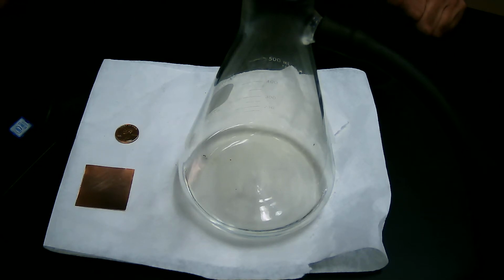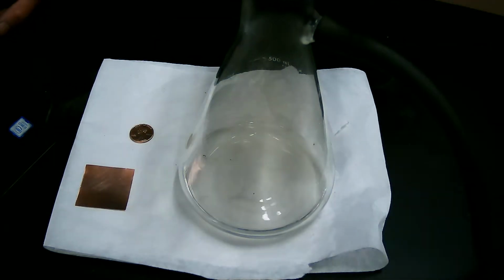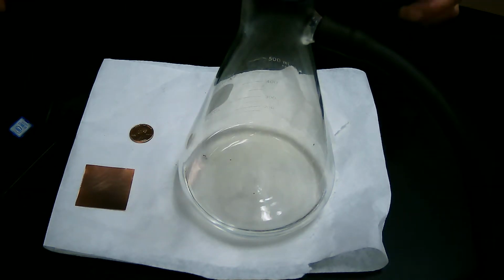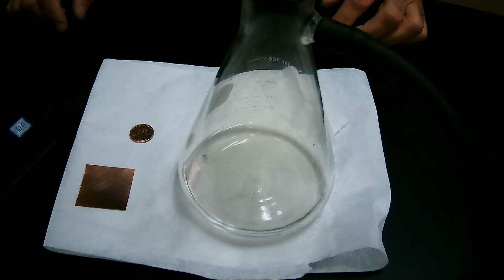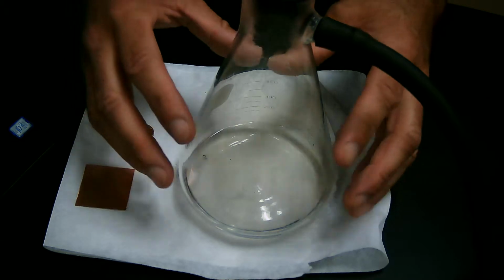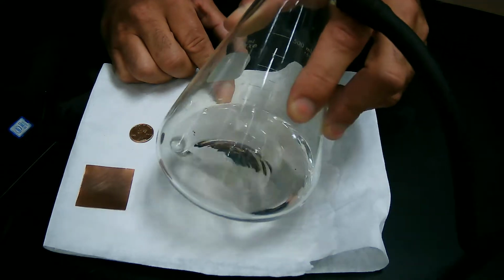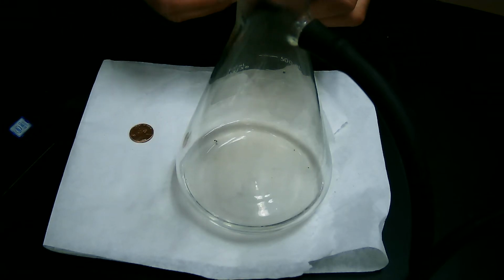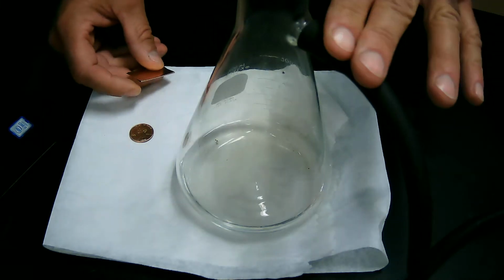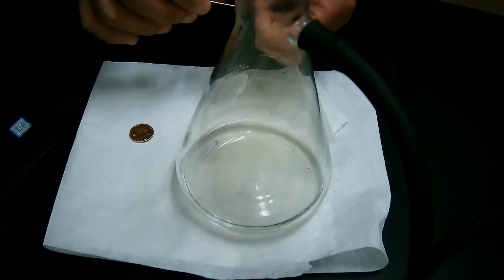So here's how the story goes. He takes the penny and he puts it down on the table and then pours the nitric acid on top. He wants to know what nitric acid acting upon a penny really means. What does the act upon piece mean? Instead of doing this on the table, and you'll understand why when we get further into the story, we're going to do this in a closed environment. So this flask has our water-like nitric acid in it, colorless, transparent, very water-like in its appearance. We're going to add in this copper foil and then close this back up. So this tube leads to a water filter that's going to separate out and filter out all of the toxic gas that is produced from this reaction.